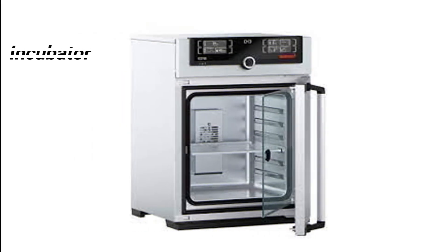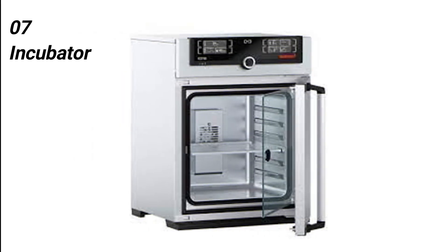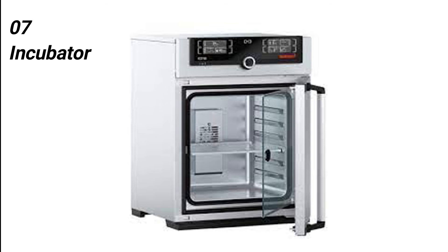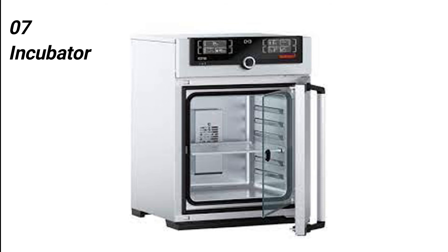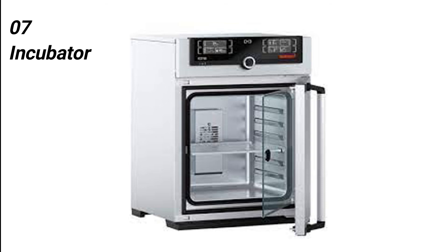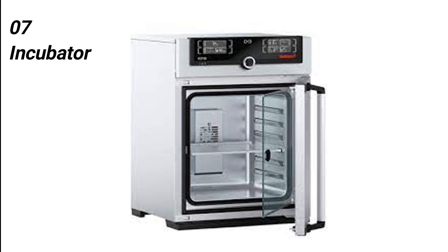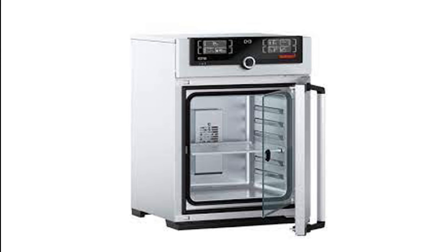On number 7, I would like to tell you about incubator. An incubator is a device that is used in the laboratories for the growth and maintenance of microorganisms and cultures. It provides an optimal temperature, pressure, and moisture, among other things required for the growth of microorganisms. Incubators have a wide range of applications including cell culture, pharmaceutical studies, hematological studies, biochemical studies, and can also be used in the stem cell research area.